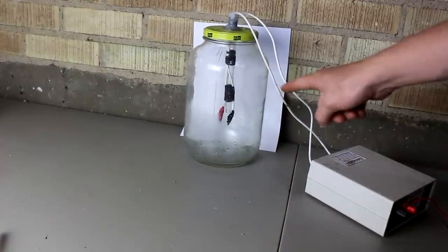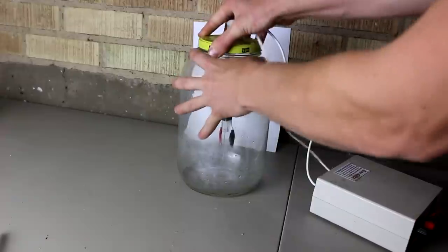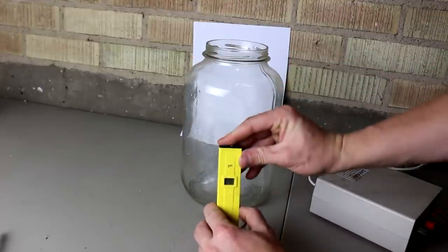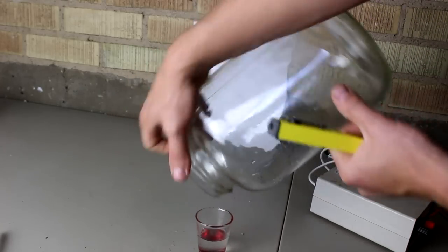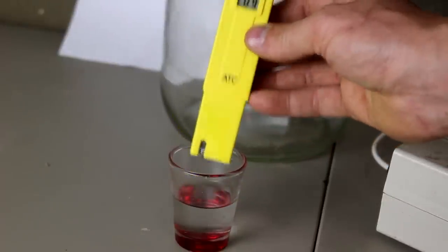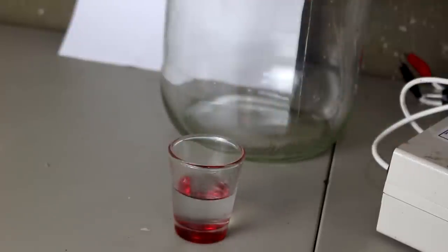It's not going anymore — I'm not sure exactly how long it ran because something happened to my power supply. Let's open this up and see just how much acid we were able to make. Let's turn the pH meter on and pour this off into the little flask. That looks like a pH of 0.8, which means it's just over 0.1 molar in concentration. We don't have very much nitric acid here — that'll probably make less than a gram worth of calcium nitrate. Well, it's better than nothing.